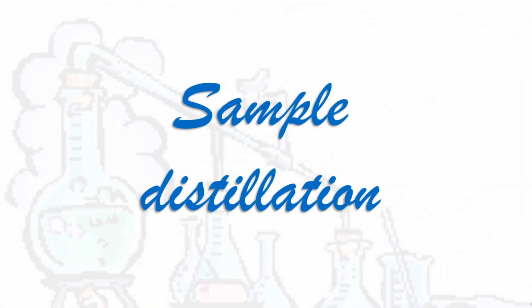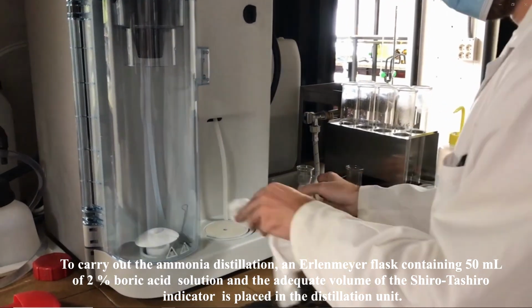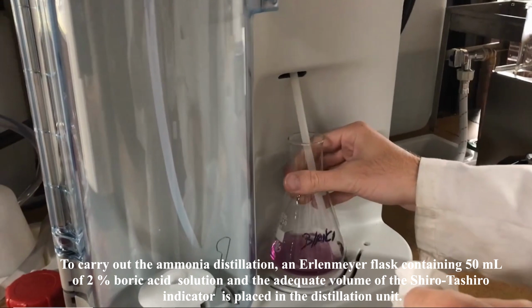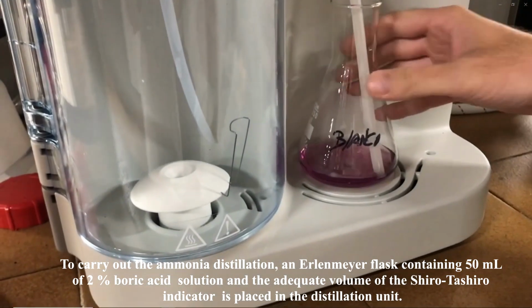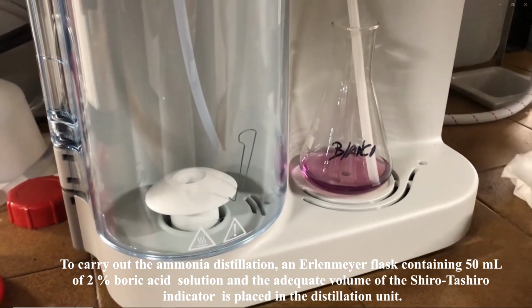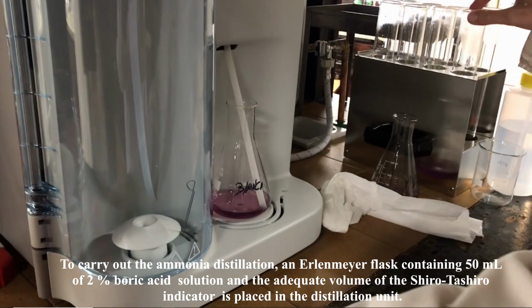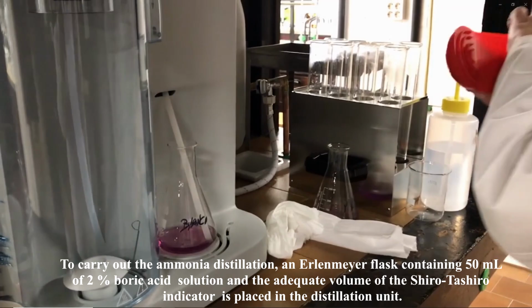Sample distillation. To carry out the ammonia distillation, an Erlenmeyer flask containing 50 milliliters of 2% boric acid solution and the adequate volume of the Tashiro indicator is placed in the distillation unit.